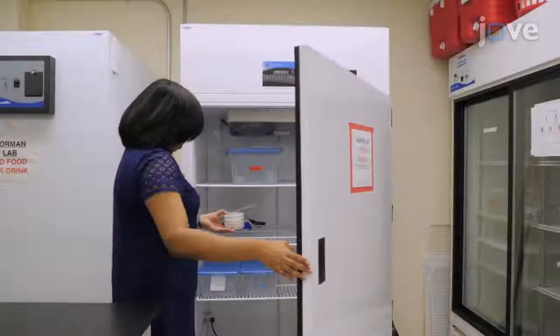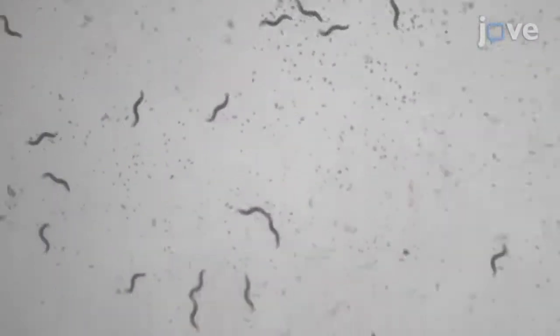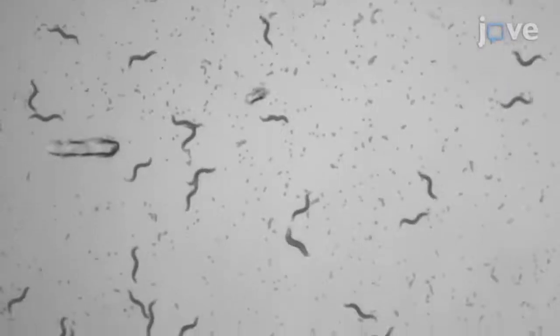Incubate the worms at the appropriate growth temperature for three to four days or until plates are concentrated with a large number of eggs and gravid worms.